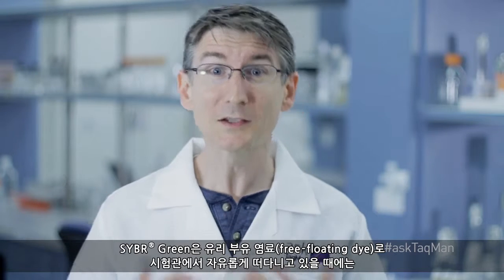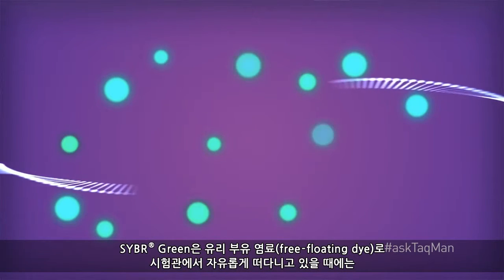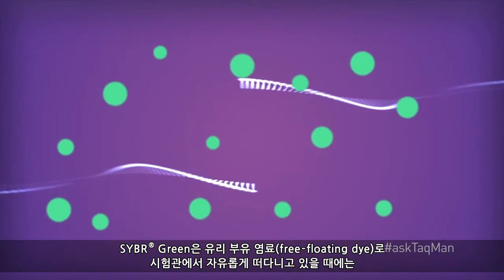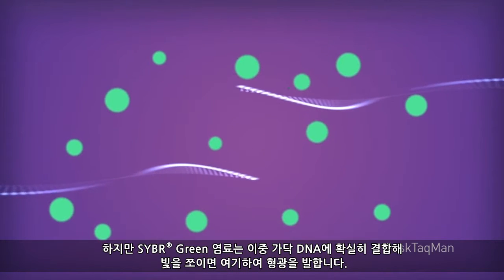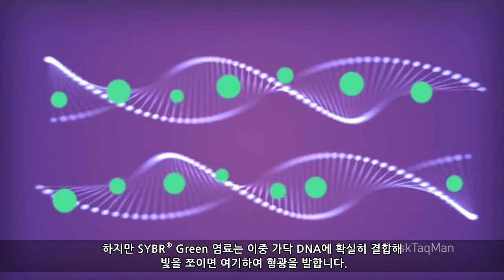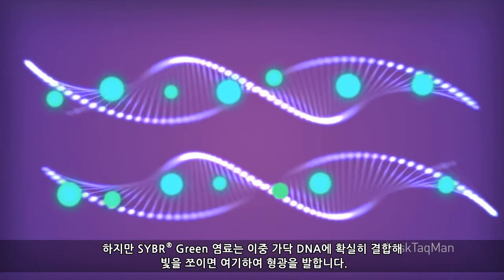Unlike yours truly, SYBR Green 1 chemistry is a free-floating dye. Here's how it works. When SYBR Green dye is just swimming around in the tube, it doesn't give off much fluorescence, even when we zap it with a light source on a real-time instrument. But SYBR Green dye really likes to bind to double-stranded DNA, and when it does, and then you hit it with light, the dye gets excited and fluoresces.